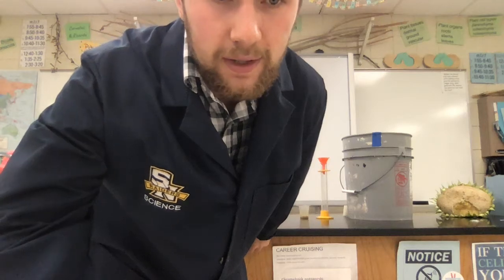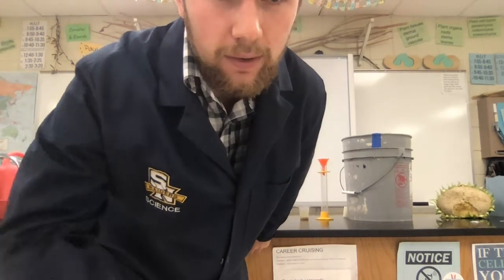Hello, botany students, and today I'm going to be demonstrating how we are going to set up and make our tomato lab. All right, so let's get going.